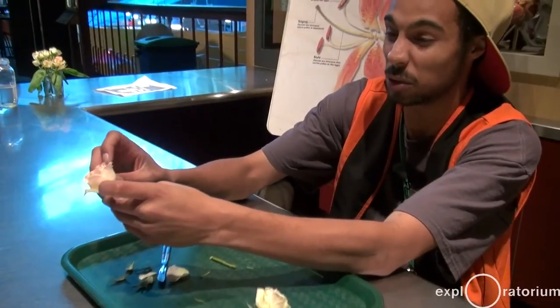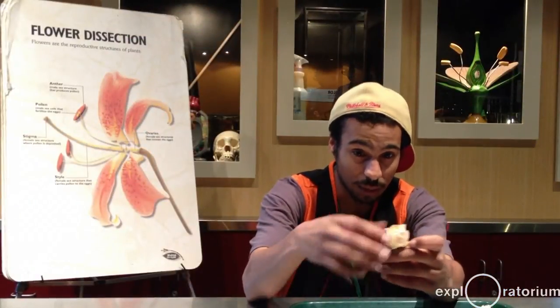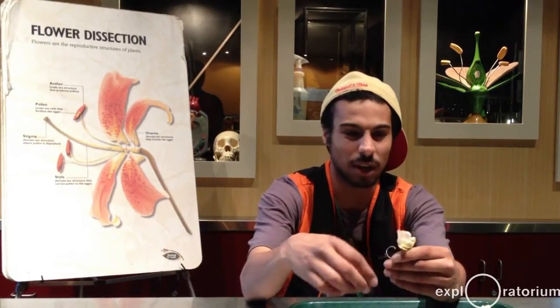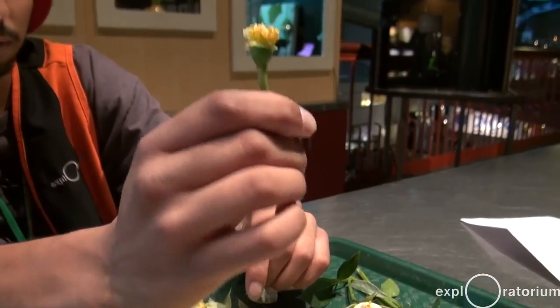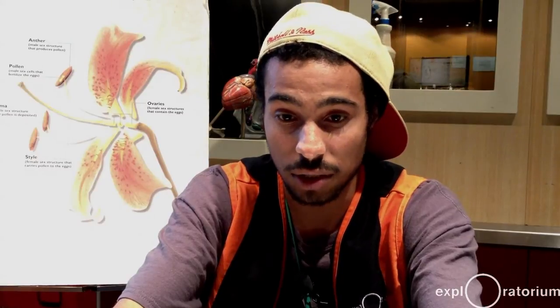Me, I like to do this to the flower. I like to take off each petal one piece at a time and bring the petals down, kind of destroy the flower unfortunately. But when you get past the petals, you actually get to the male and female parts of the flower. And this is where the genetic diversity actually starts.